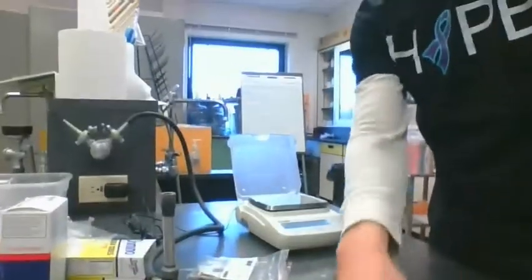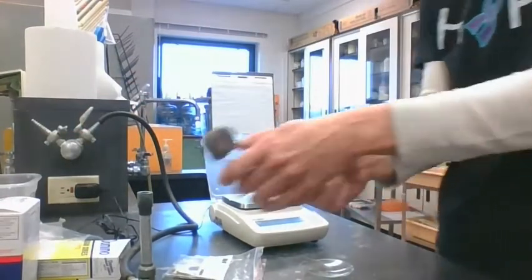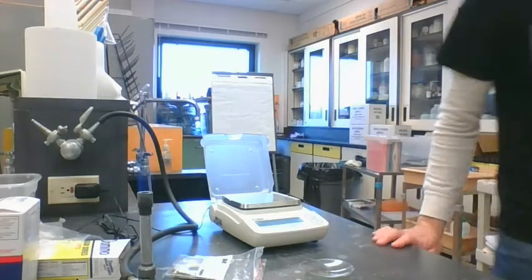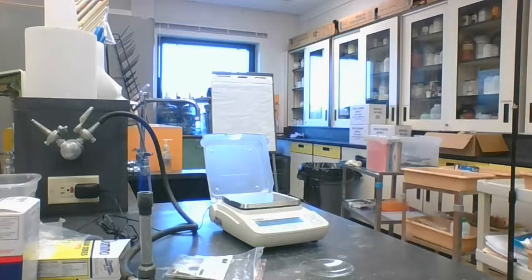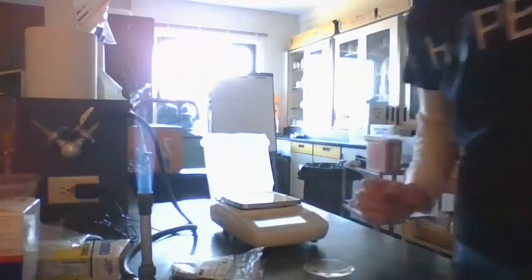Okay, I just needed to grab some goggles before we go ahead and do our lab here. So we got the Bunsen burner. Get that thing lit. I'm going to shut the lights off. I should probably reverse this so the window is not in the way.